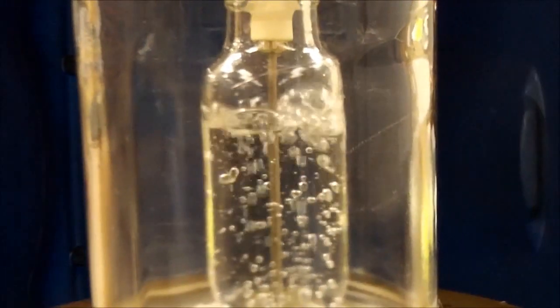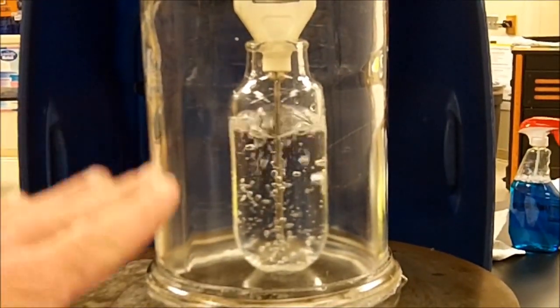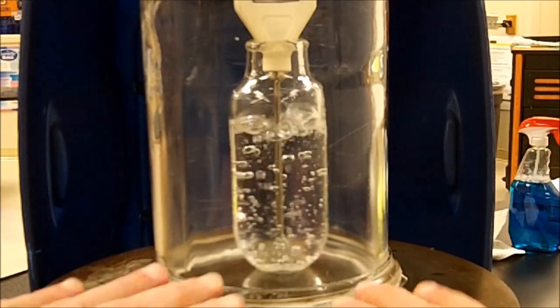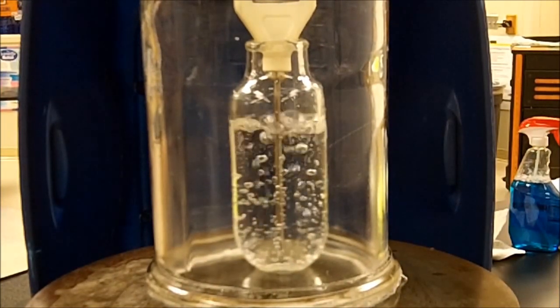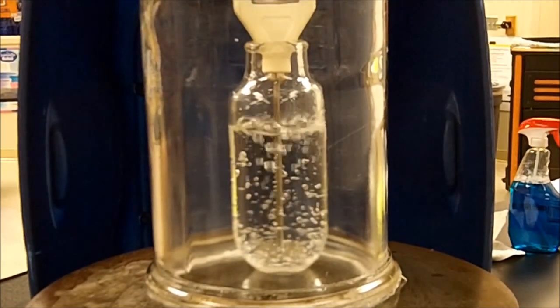Now, again, it's boiling pretty well here, and that didn't take a whole lot of time. But as we look at this, and I'm going to zoom back out, I didn't do anything to this. It's not hot. I'm touching the plate itself. It's not heated. And again, that took place rather quickly.